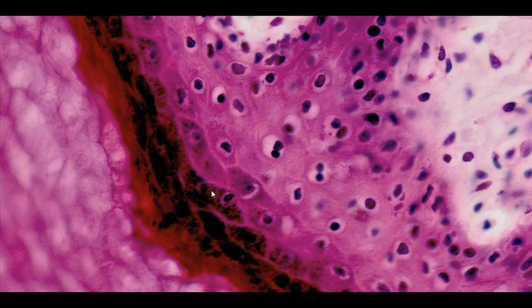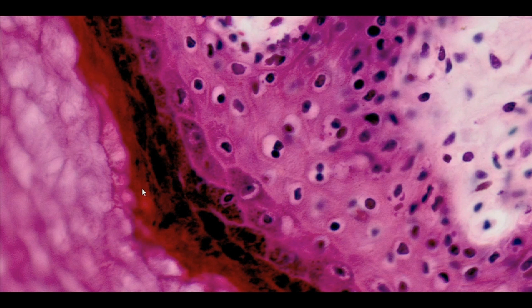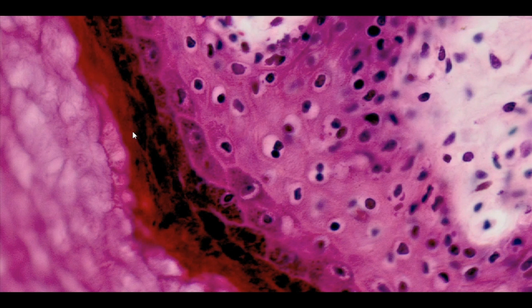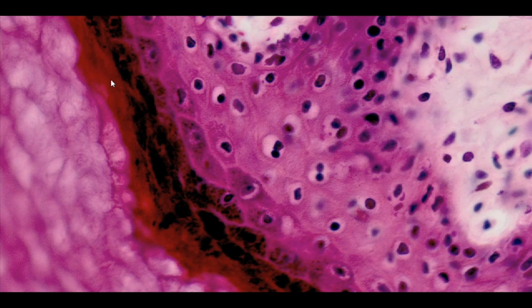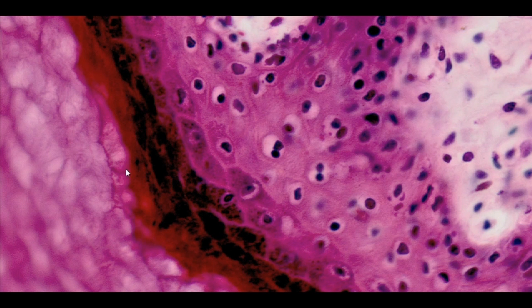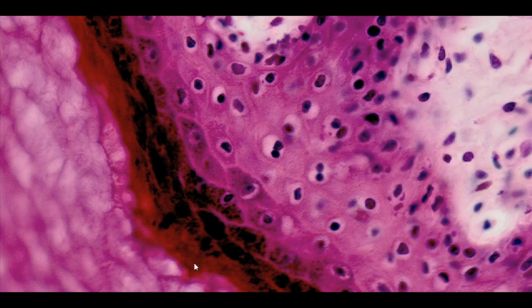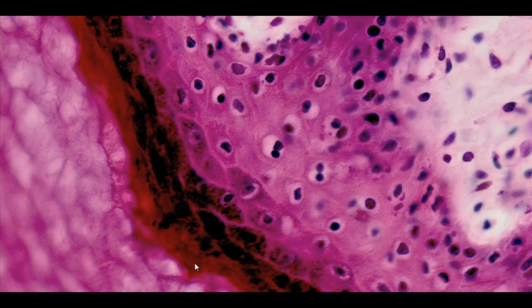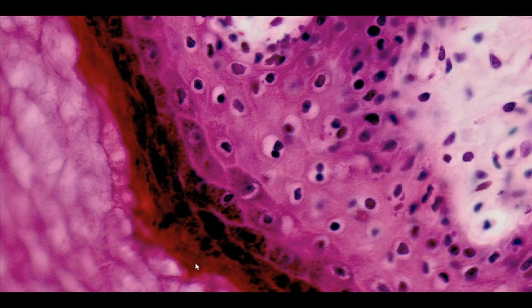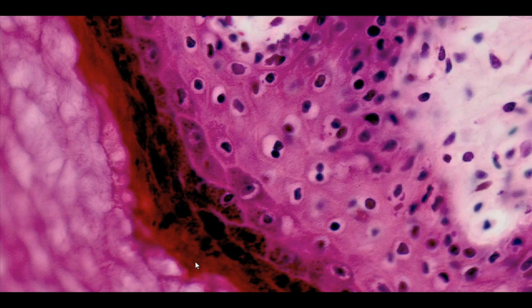The stratum lucidum is the next layer. It is found only in the hairless skin and is characterized by high acidophilicity. The cells in this layer undergo apoptosis and are already dead elements, devoid of cell nuclei.